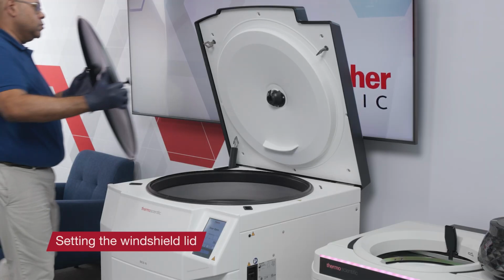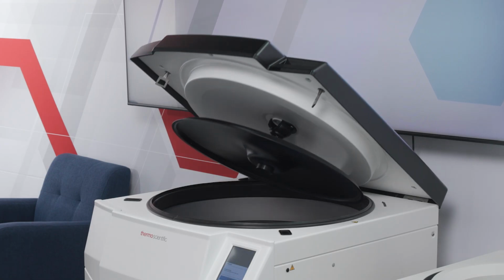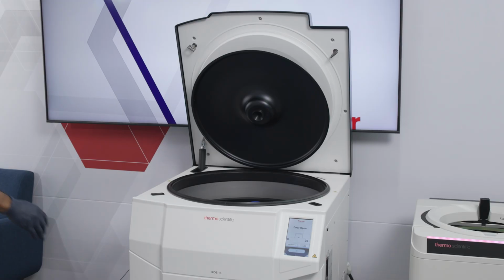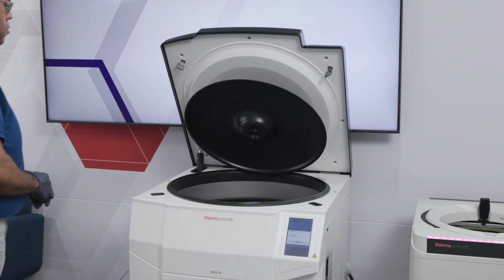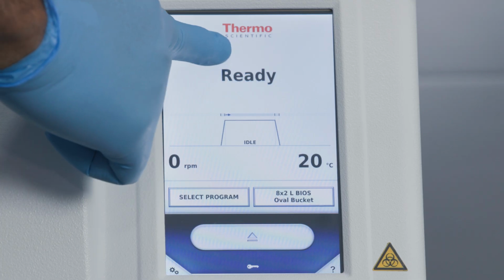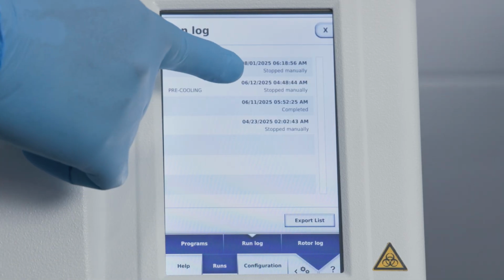The next step is to set the windshield lid onto the holder on the inner side of the centrifuge door. The Thermo Scientific auto lid function automatically opens and closes the windshield when the centrifuge door opens and closes. Close the centrifuge door using the auto door function by pressing the Close button on the touchscreen. When the centrifuge door is closed, the touchscreen will display the Start button. To learn how to set up centrifugation parameters and configure additional settings, please refer to our touchscreen operation video.